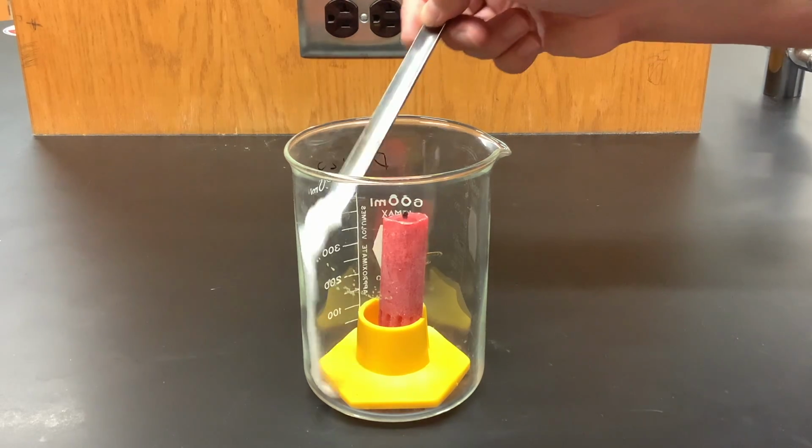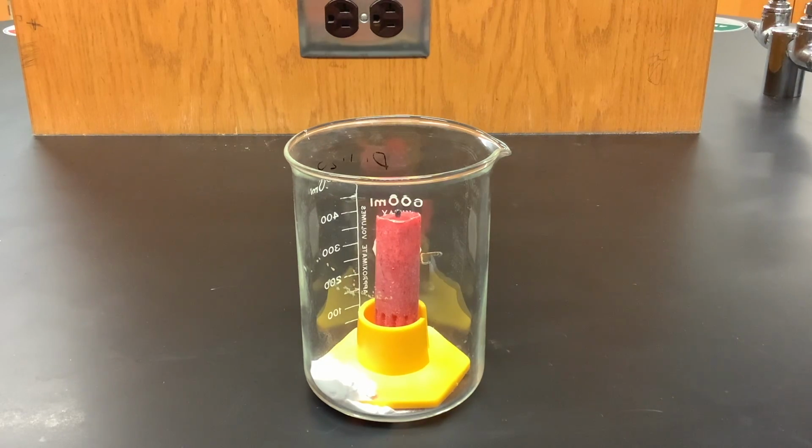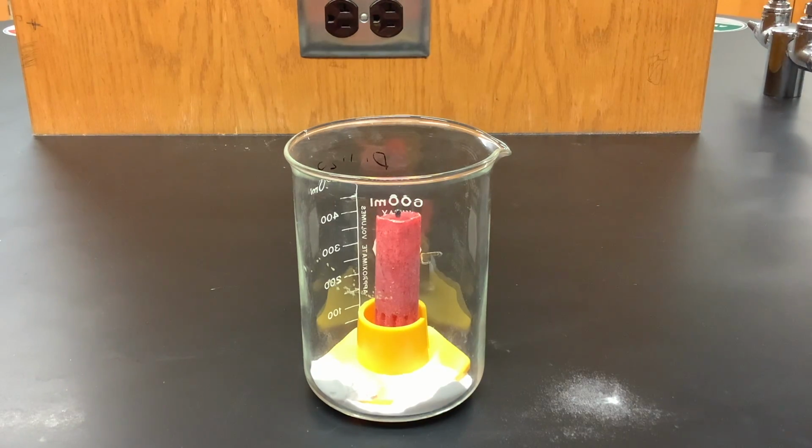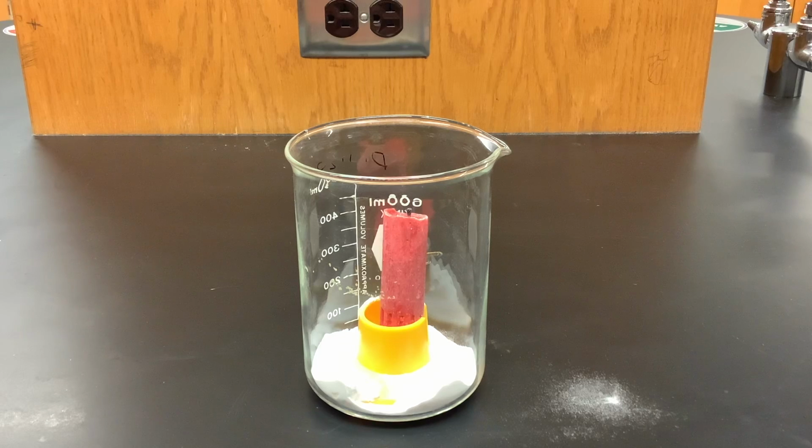And what I want to do is put it around this candle so that I can measure the flammability of this gas. So I have some sodium bicarbonate and I have a little candle stand just so my candle doesn't fall over. I'm going to add vinegar and I'm going to watch the effects on a flame. So I want to light my candle so that I can tell if carbon dioxide is flammable or not, if it supports combustion.